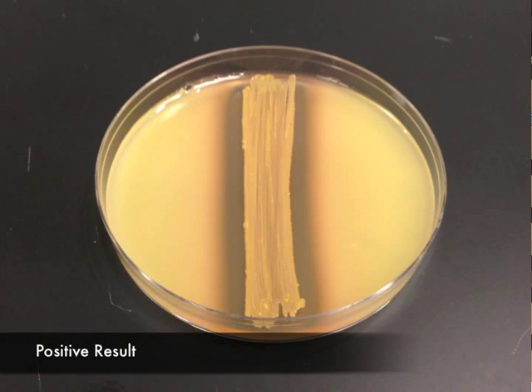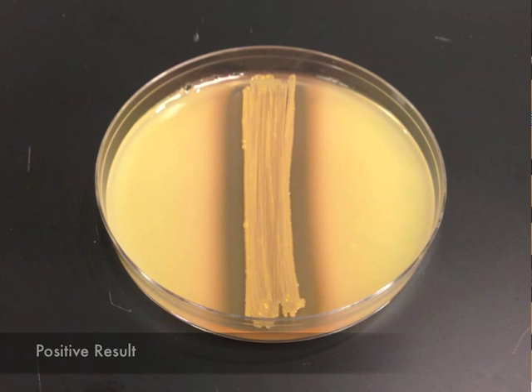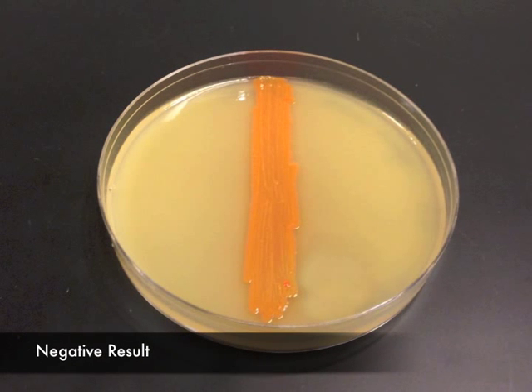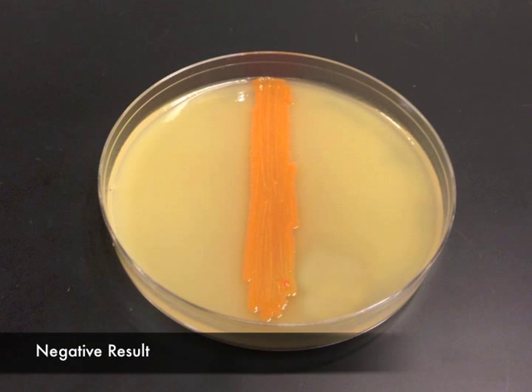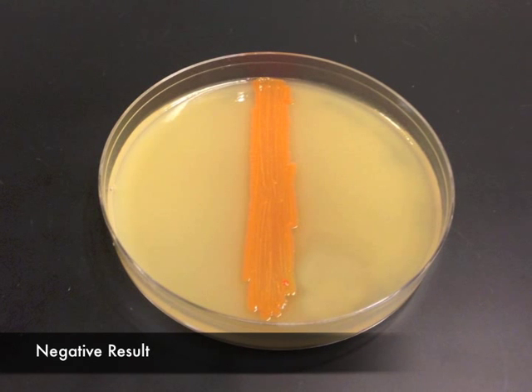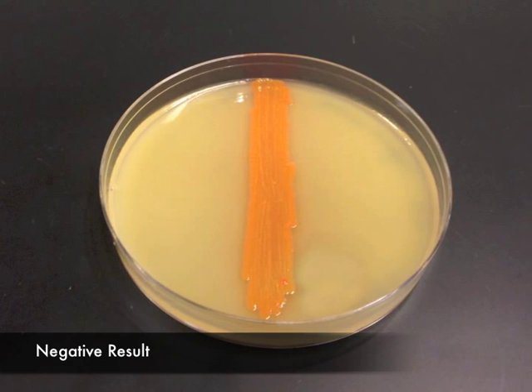In a positive result, there is a clear halo surrounding the bacterial growth. This is an example of a negative result. The plate remains opaque around the area of growth.